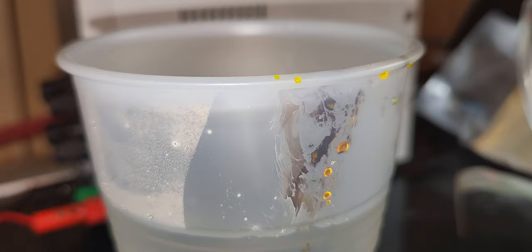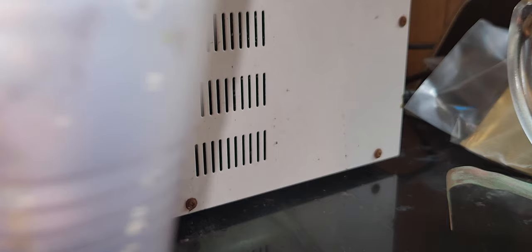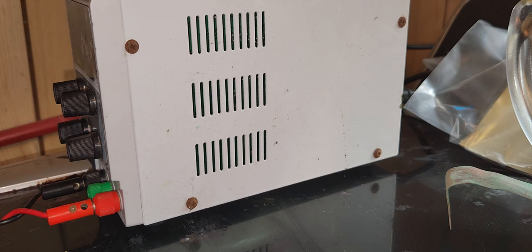That's about 500 milliliters. This is going to be about a liter. I put in about 5 grams of bismuth trioxide with 250 milliliters of concentrated hydrochloric acid which got quite hot.